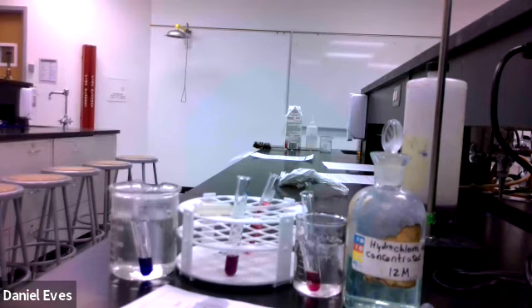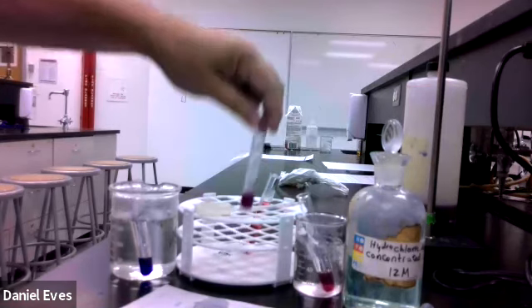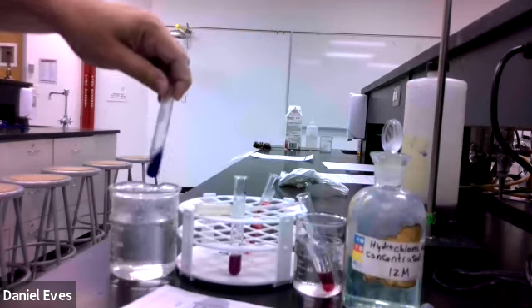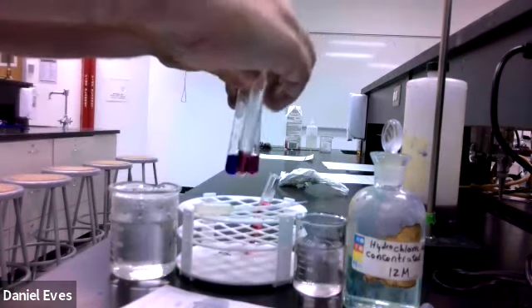So after adding 5 drops, we've lessened the concentration of chloride around each of those. And so if we just take a look at the colorations of those, we can see in the cold, we're back to almost the original color, even though we have chloride ion in there. Here, we're kind of halfway through that purple. And even with the 5 drops of water, the hot is still that deep blue. So here are our 3 different colors: cold, room temperature, and hot.